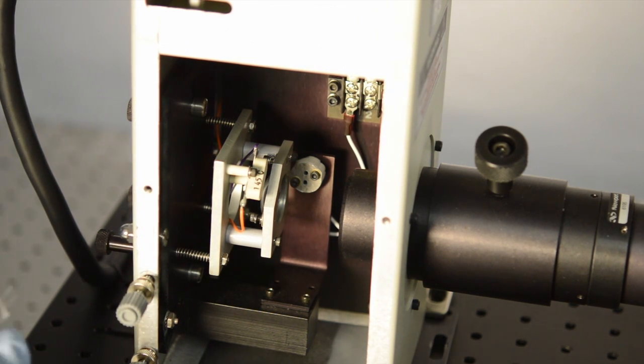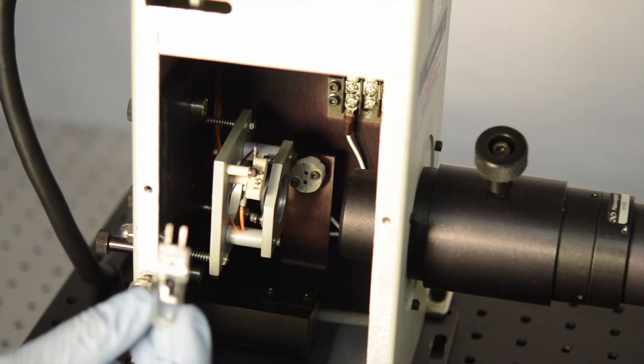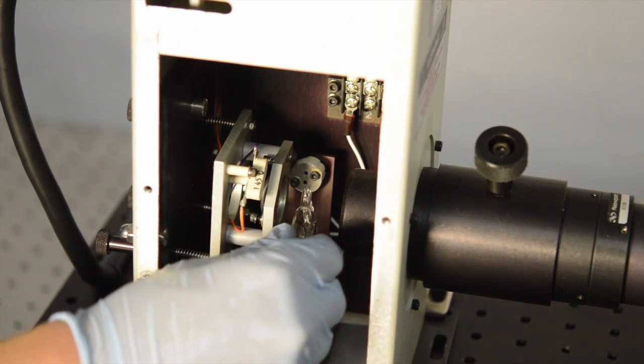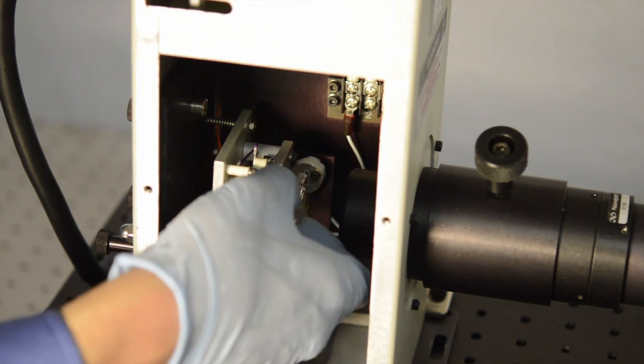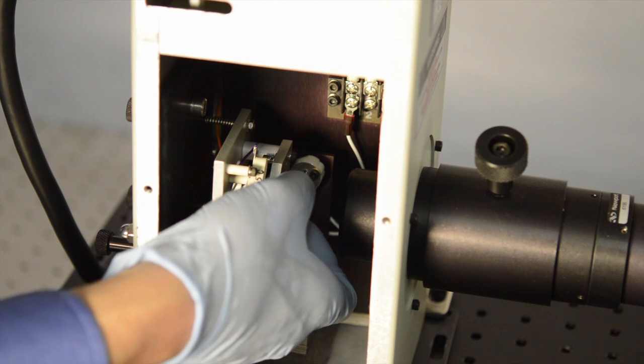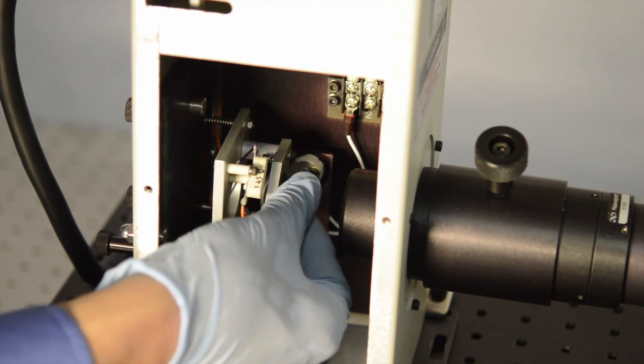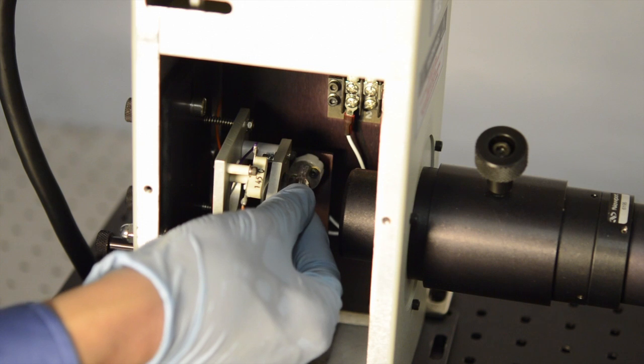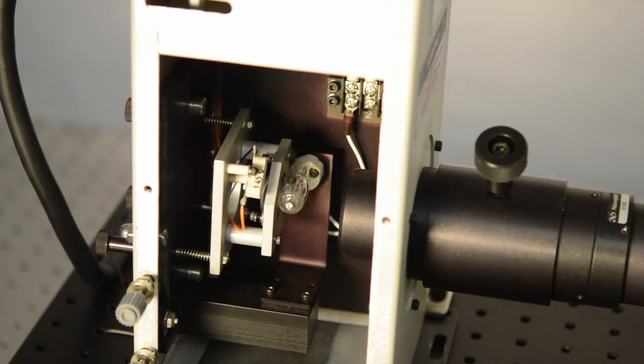So this is our new lamp. You can see the socket adapter and here are the prongs of the lamp. It should gently slide in and be very careful not to bend the prongs or bend the lamp any more than necessary. It's just going to seat right inside the socket adapter like so.